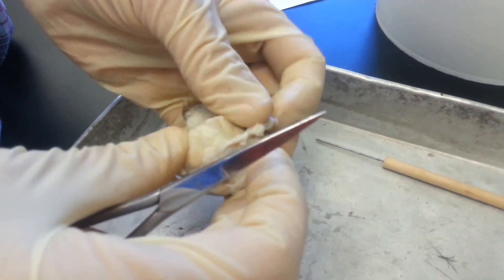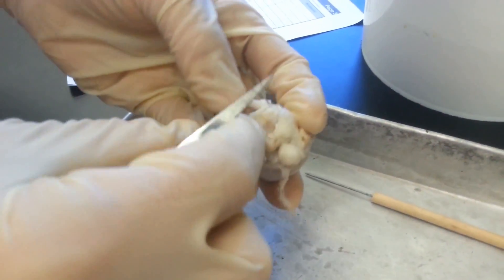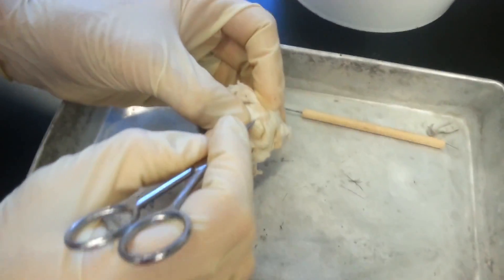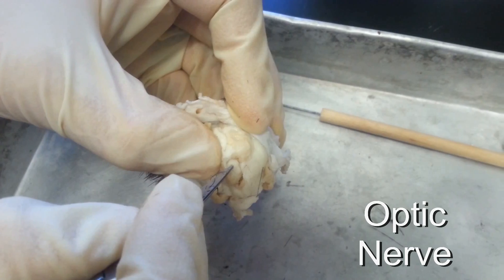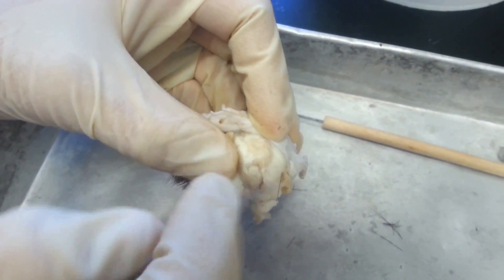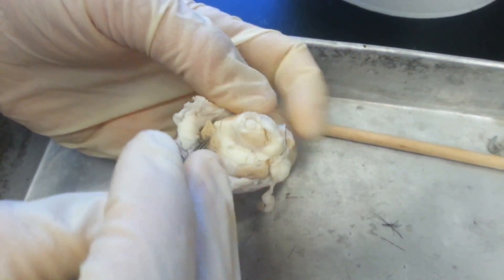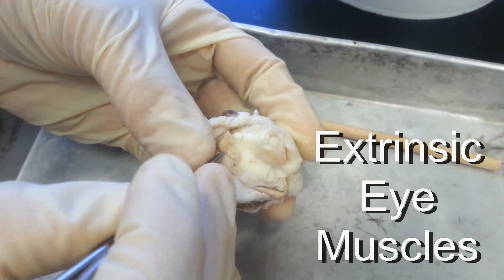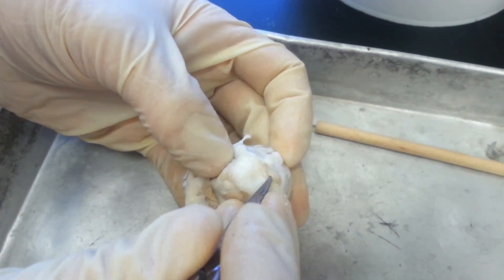In the back here you have the optic nerve, which connects to the brain and sends impulses to and from the brain. You can also see the extrinsic eye muscles here — these are the muscles that move the eyeball so you can look to the left and to the right.